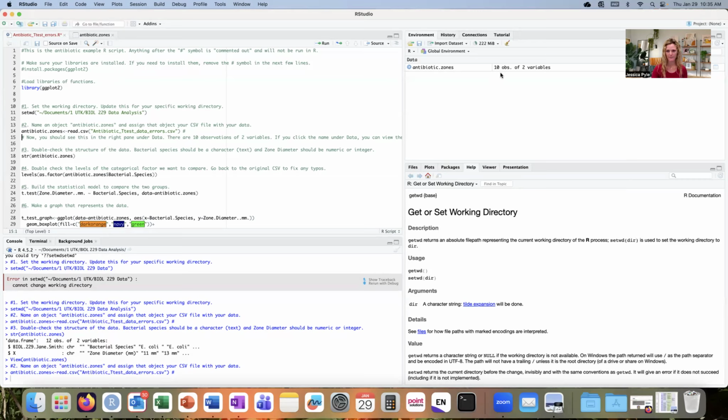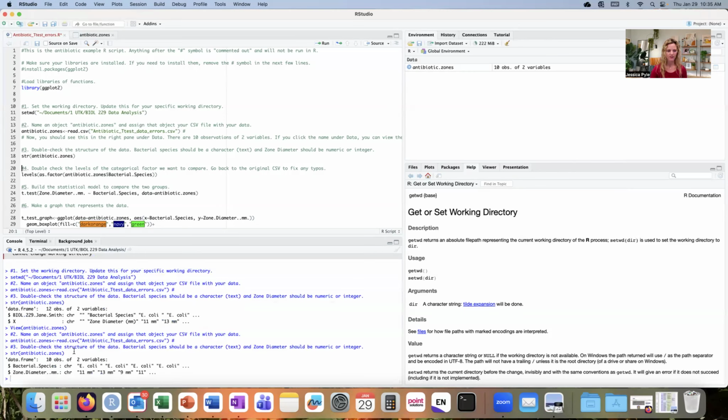I can tell that it's updated because now I have 10 observations, which sounds right. I know that I made 10 measurements. I can go down to line 18 and inspect the structure of that object by hitting Command Enter. So we're looking at a data frame. We have 10 observations, 2 variables. That all looks right. I have my first column is called bacterial species. It is a character variable type, meaning it has letters and punctuation and space. I've got a few examples of E. coli provided here from the first few rows of data.